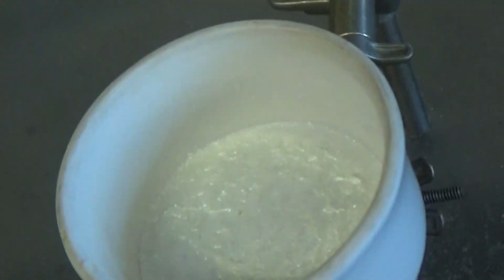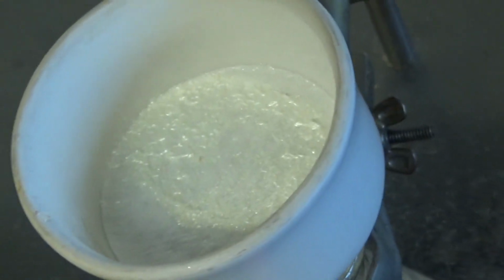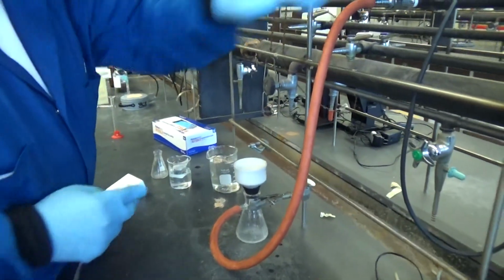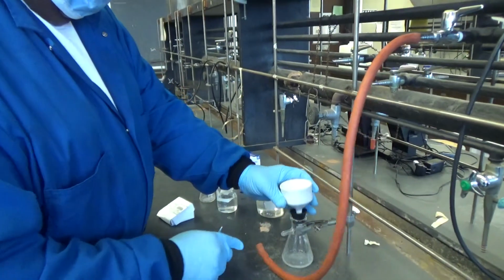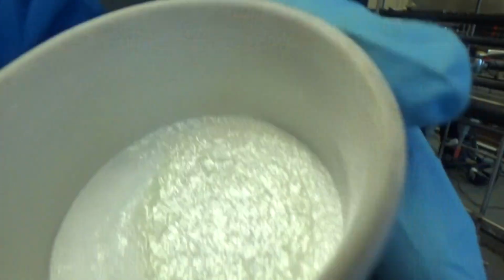So where is my spatula? So there's the pure benzoic acid, purified benzoic acid. Yeah. That's done. I'll stop the vacuum. Stop the vacuum first. You waited about a minute. Yeah. And then that's your pure compound. Yep. And I'm going to collect it. Really crystalline. Yeah.